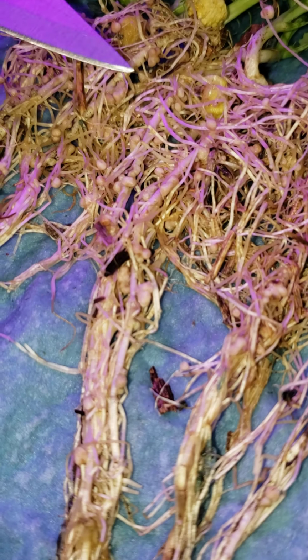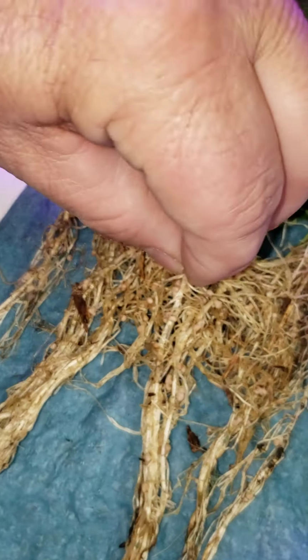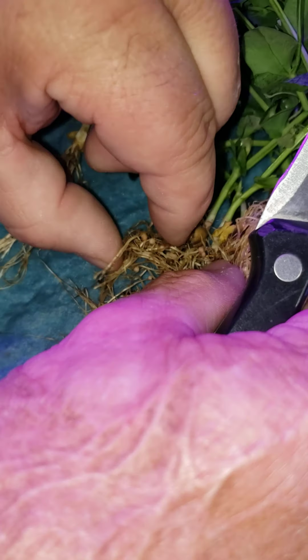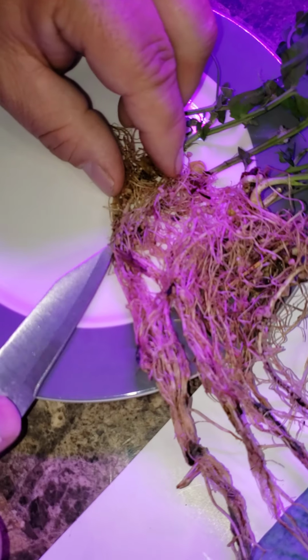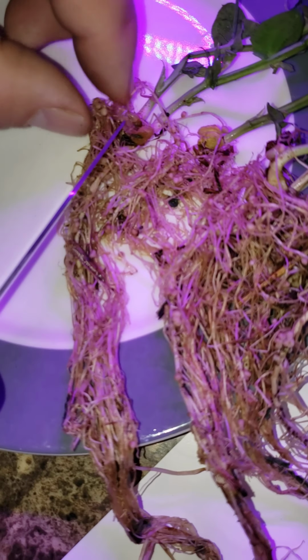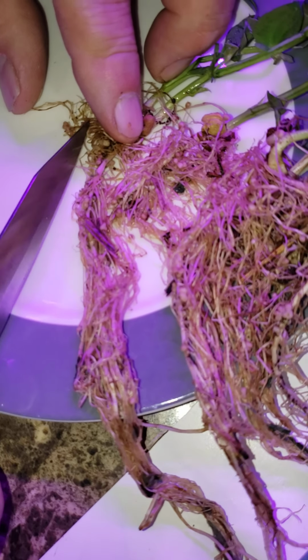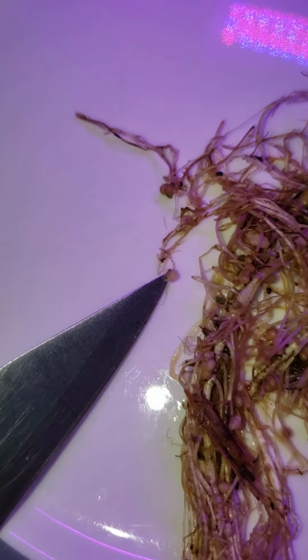So when we've got good nodulation on the roots like this, as we can see here, lots of nodules that are actively fixing nitrogen, we can tell that by, if we take, let's pull this apart here, they're kind of hard to separate, but if we take those nodules and we take one of them and we cut them open, we can see inside that nodule a beefy red color in the interior of the nodule.